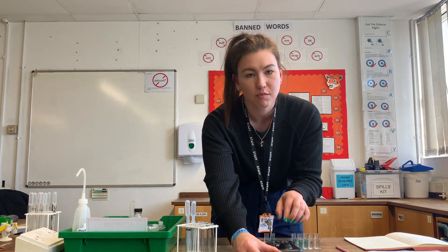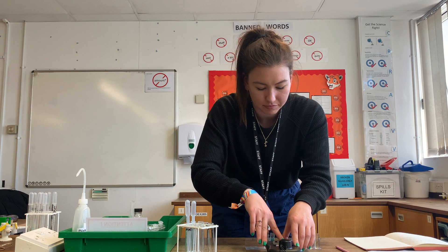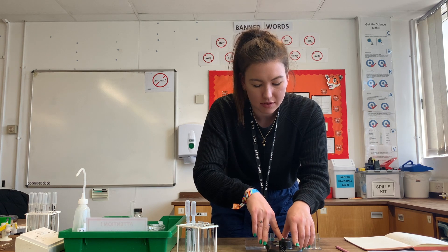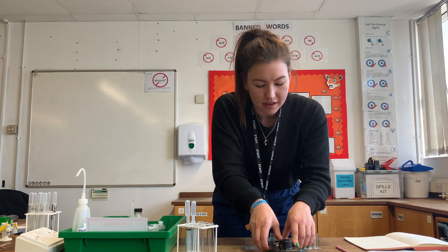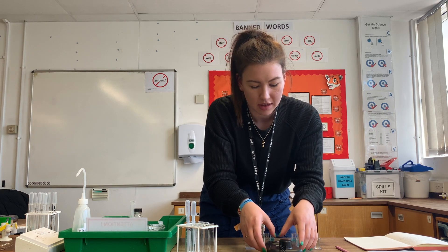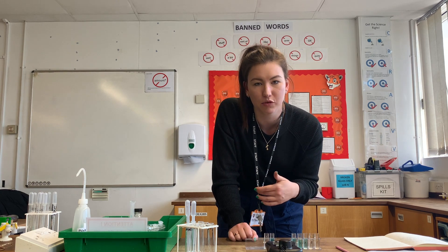I've put in my distilled water, popped the cap on top, and pressed calibrate. Because we're reading transmission, the value we should get will be 100, because almost 100% of the red light will pass through distilled water. But as you start to have increasingly blue solutions, less and less light will be transmitted.